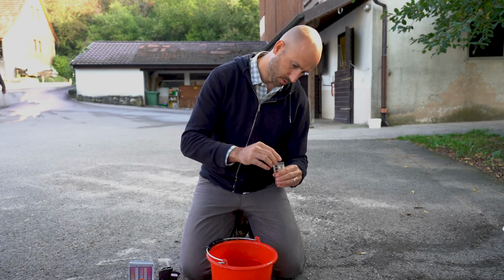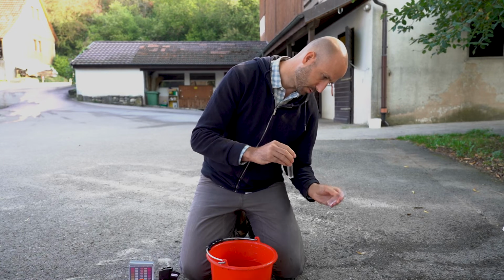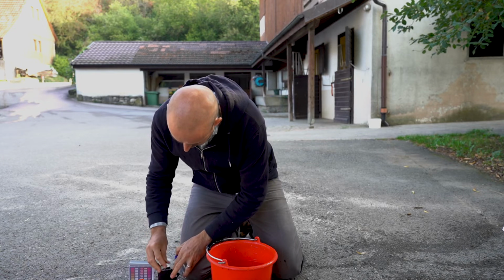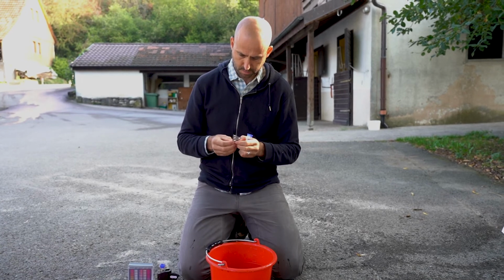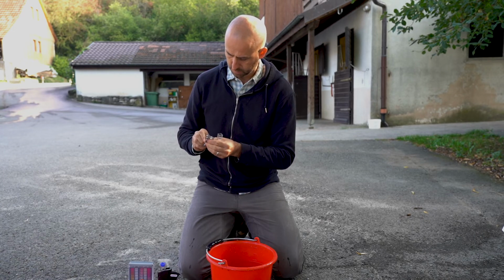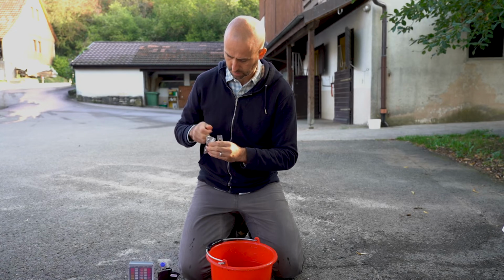With the color wheel, we want to make sure that the container has the appropriate amount of water, which is 10 milliliters. One sample vial is placed on the outer side of the color wheel, and to the second vial we add DPD, which may come in powder or pill form. Only use the DPD provided by the device manufacturer and make sure it is for measuring free chlorine and not total chlorine.